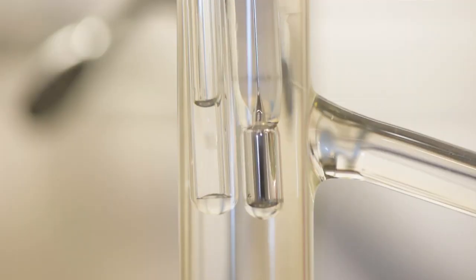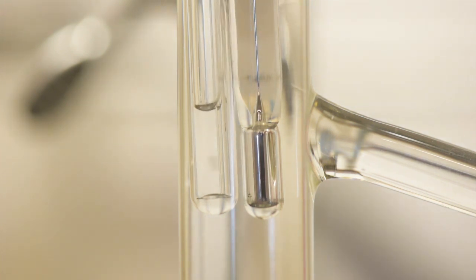You will want to record this temperature, at which you first see a steady stream of bubbles coming from the bell tube. This is not the temperature you will use to determine your unknown, but it will give you a better idea of the temperature to record in the following steps. Once you record this temperature, stop heating.